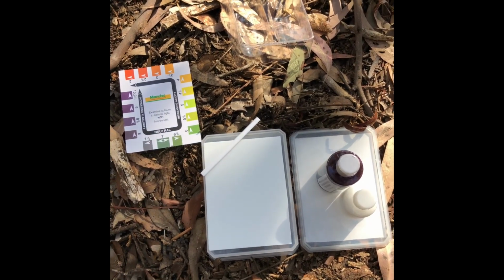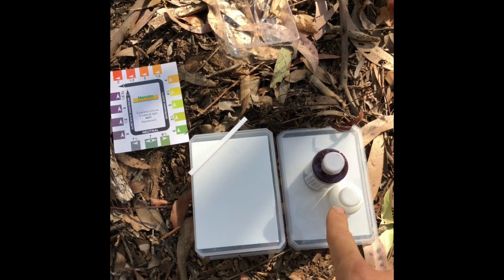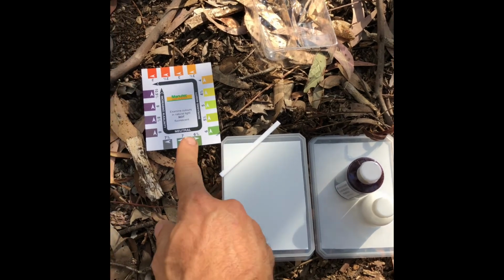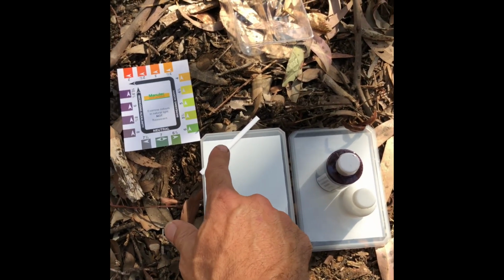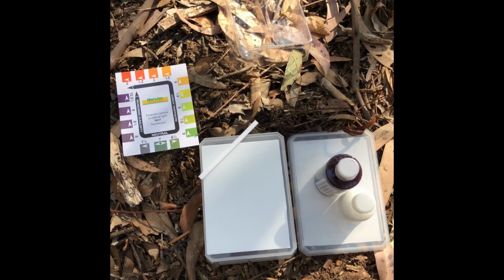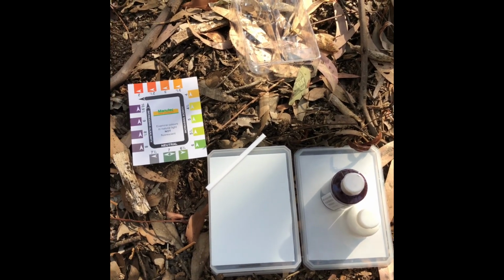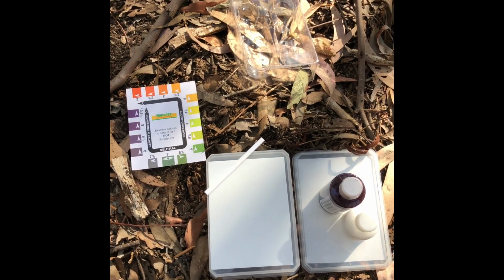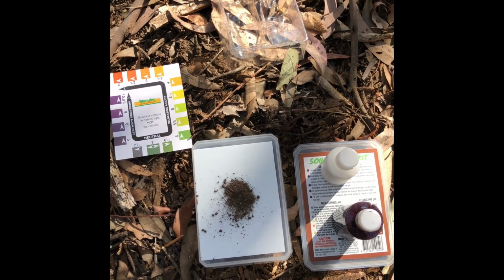When you open up the soil pH test kit, there's a number of things that you're going to get. You're obviously going to need the two chemical reagents, which we're going to mix to create a color that we can use with this chart to work out what the pH is. We need a little stirrer so we can stir the soil and the chemical, and we need a white tile so we can see that color change when we do it. So these things are what we need to do this chemical test. The last thing we need is obviously a bit of soil so that we can do the soil pH test.